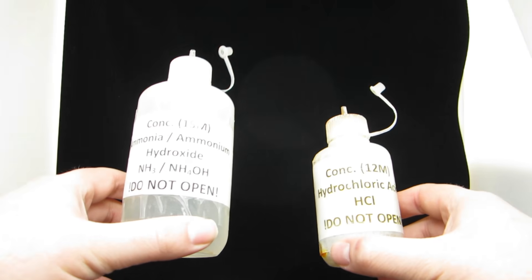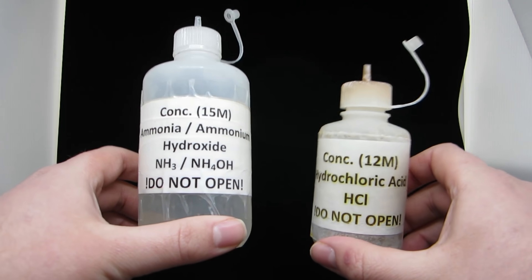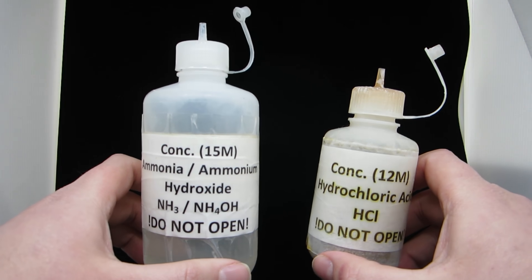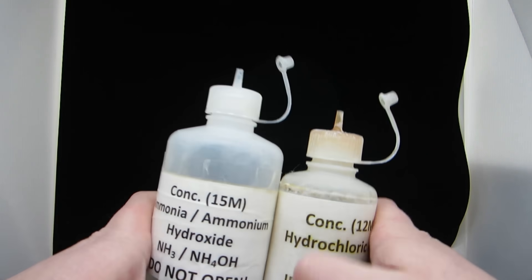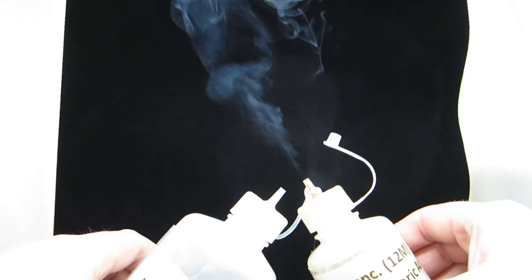The fourth reaction is a reaction that occurs in the gas phase. By taking concentrated ammonia and concentrated hydrochloric acid, each of which in their pure form are a gas, and reacting them together in the atmosphere, you get the formation of a white solid in the air.